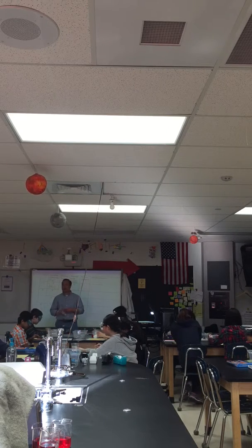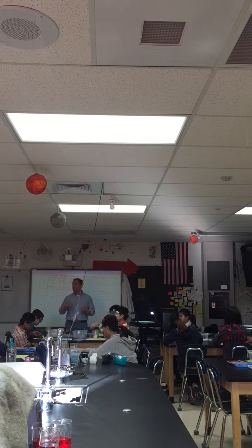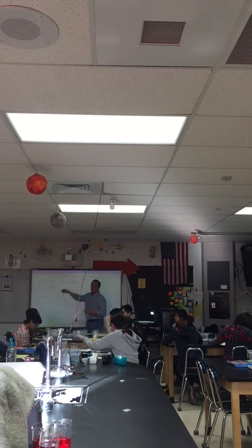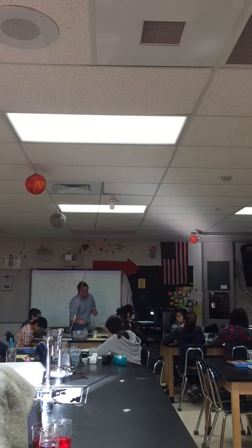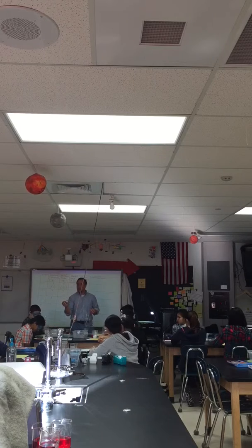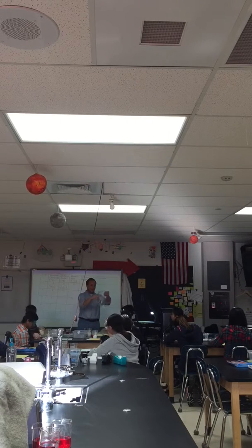Let me explain how number 1 is going to go. You might do the same process with tests 2 through 10 as well. Remember, one of the procedures was to make sure that the chemicals do not interact before you mix them. So I'm going to take 15 grams of calcium chloride. You're actually going to measure it out. I'm going to put some in the corner. That's not 15. You will put more.